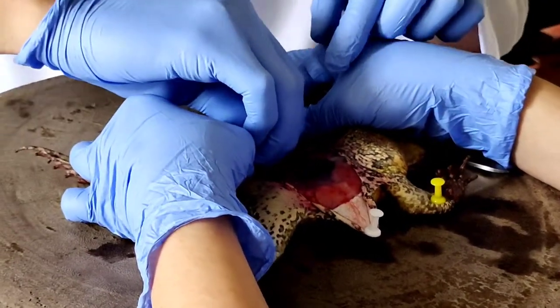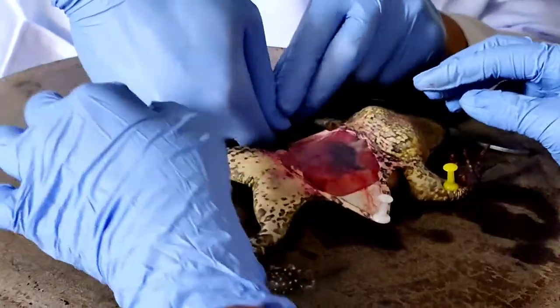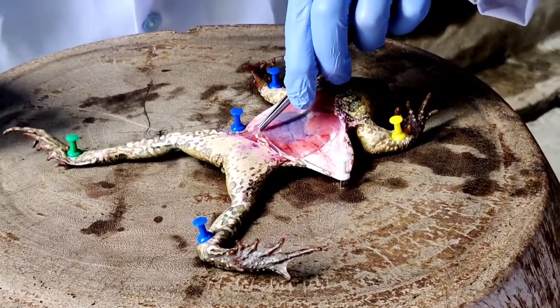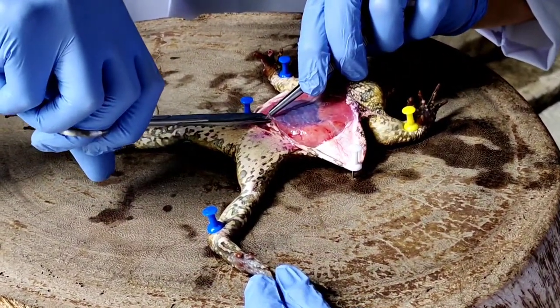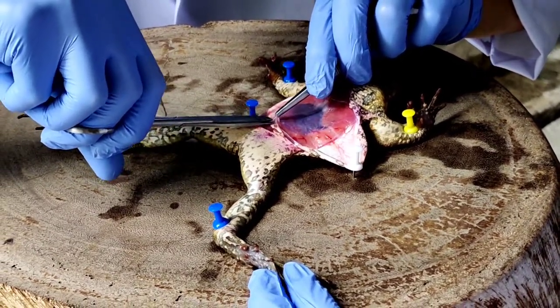After scraping, we bent down the skin on both sides. We did the same process for opening the muscle tissue. It was lifted up using the forceps, then cut in a straight line, starting from the bottom all the way to the top.